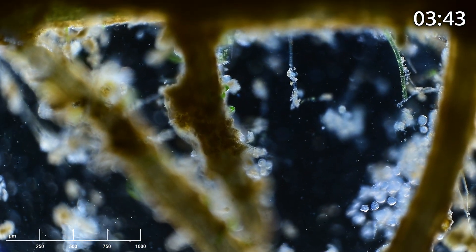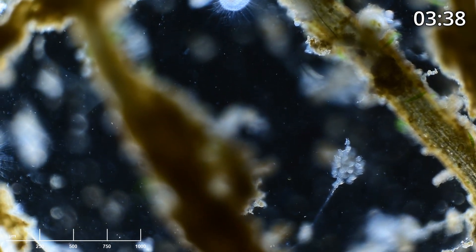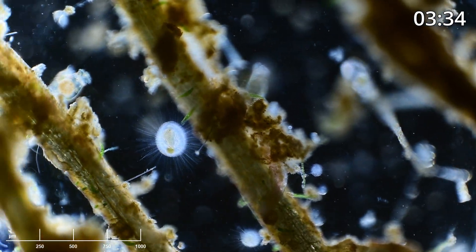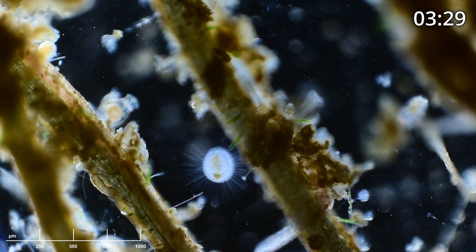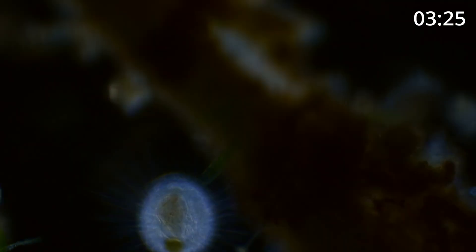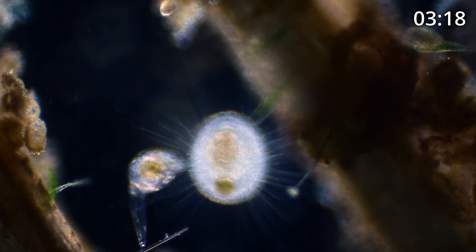That was a really nice section of the slide. We're down to about three and a half minutes left — let's see what else we can find. There's another heliozoan; it seems like there are going to be a lot of them in this sample. Look at that one — it looks like there's something inside the heliozoan. Let's take a look. There's something alive in there, still moving. It looks like cilia beating.